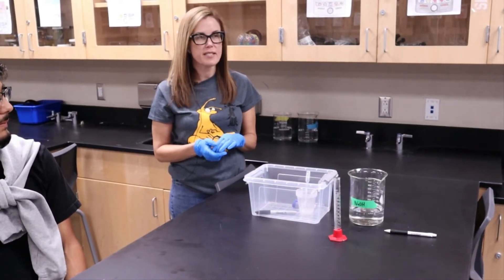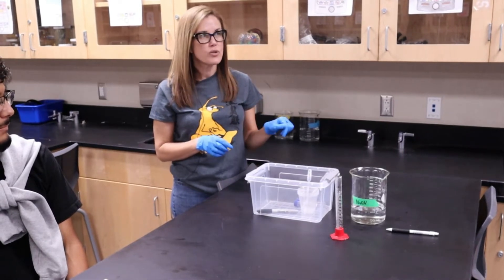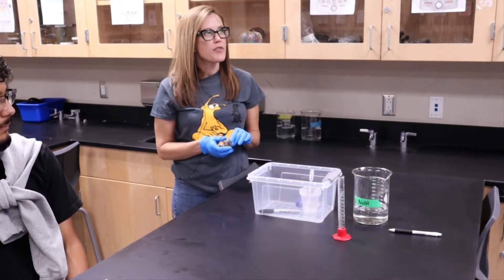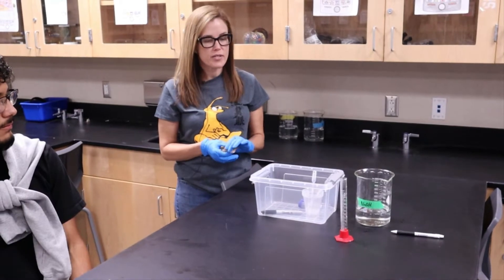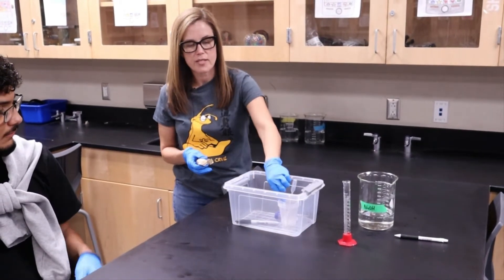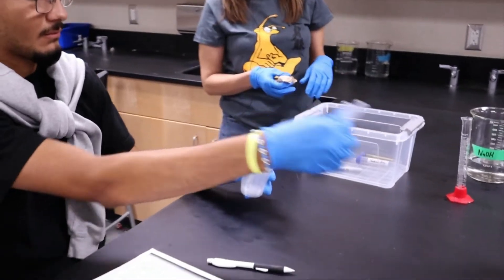The objective of this part of the lab is to engineer your own shellac-based enteric coating that will dissolve in the small intestine. Once it enters the small intestine, it has to dissolve between five and six minutes — no sooner, no later. For the purpose of this lab, you're going to test your different coatings on cover slips, so remove the cover slips and set them out.